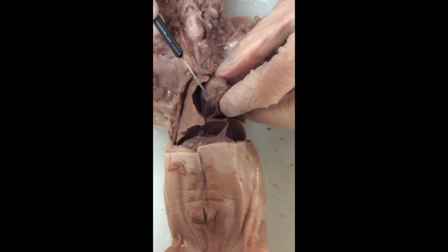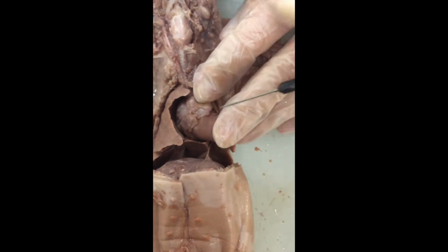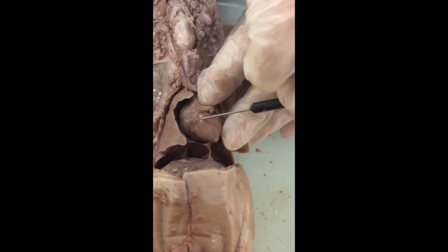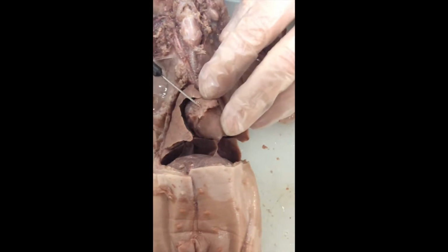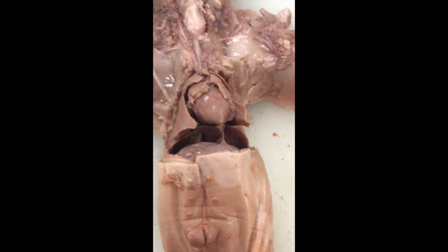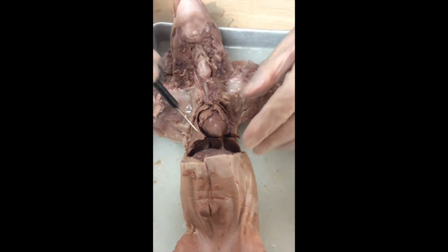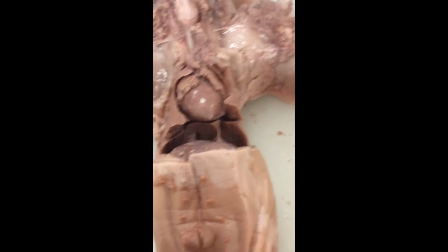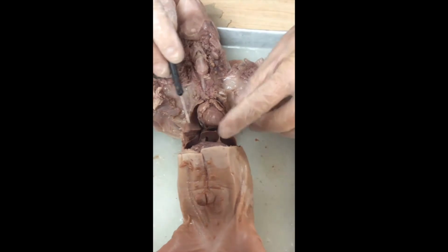We would be reminded that the heart itself was encased in a bag, and I have some remnants of that bag right here, the pericardial sac. I'm having trouble getting under that, but you can see the bag right there, what's left of it. And as a matter of fact, you all probably noticed that when you opened up the chest cavity, all of the organs of the chest cavity have membranes holding onto them. We still see some remnant of membrane right here. We do not have organs just bouncing around inside of our body. They are held together with connective tissues.